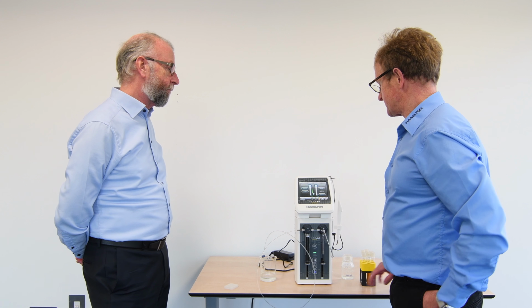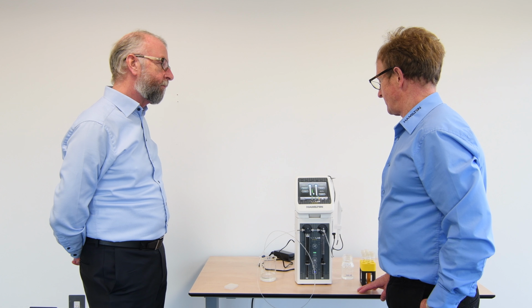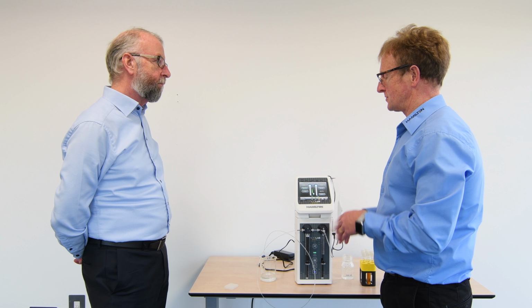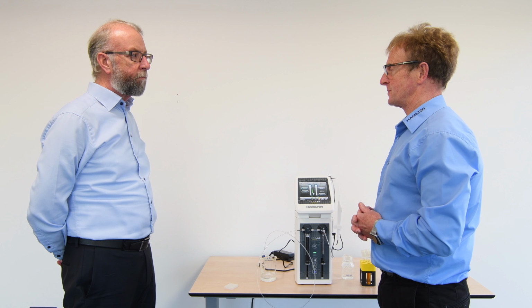Yeah, it's a good question, Chris. I think particularly with high viscosity materials, there's always the concern of carryover. We are more often confident that with dilution ratios more than around 1 to 2, 3, we would get a complete exchange of material out. However, we do appreciate the right to absolute confidence.